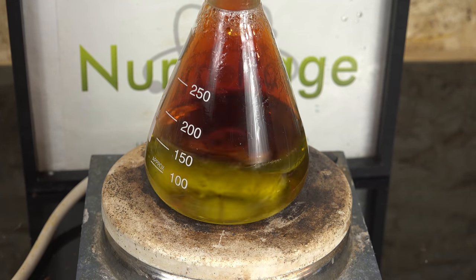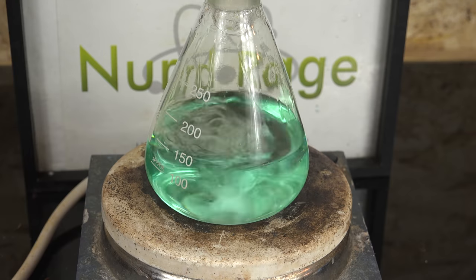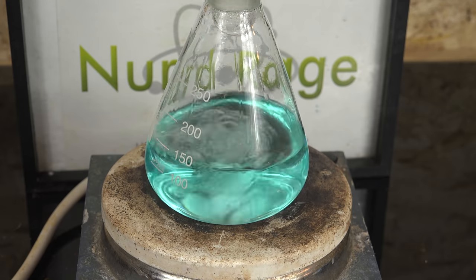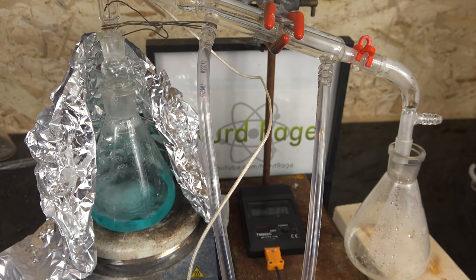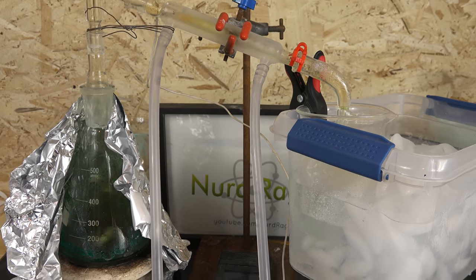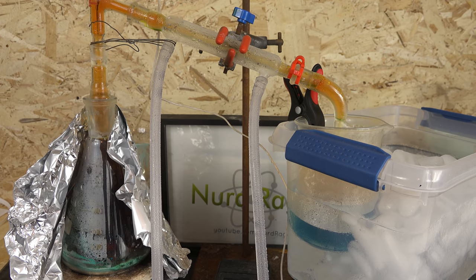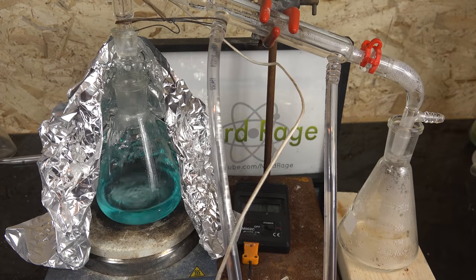To measure the yield I first mixed them all and then attached a fractional distillation column and boiled off the excess water to reduce the volume down to around 100mL. This is done to drive off any unreacted gases that would interfere with the yield measurements, and to increase the concentration, as dilute nitric acid of lower density tends to give inaccurate results when using density to determine yield. At this point you can see a persistent blue color — that's actually small amounts of copper. The decomposition aerosolized some of the copper oxide particles as the copper nitrate decomposed, sometimes violently like popcorn. So to purify the nitric acid I distilled it. Meanwhile, during the whole synthesis I was also running a parallel experiment with the exact same quantities, but this time using the crudest receiver setup of having the nitric acid and nitrogen dioxide directly fall into a beaker of water. I wanted to compare yields and see if the extra effort of a complicated receiver setup was worth it. I ran ice water through the condenser and used an ice bath to keep the receiver cold, and also purified the acid to obtain a yield.